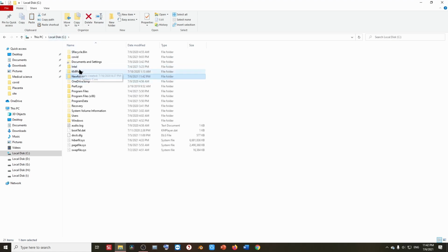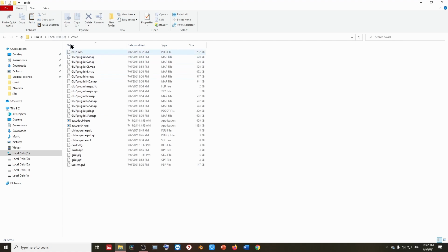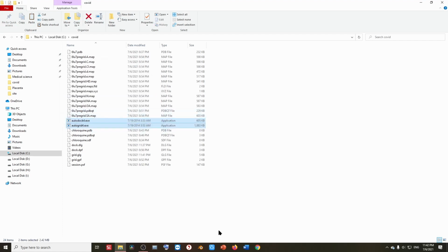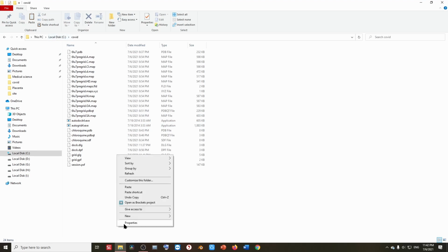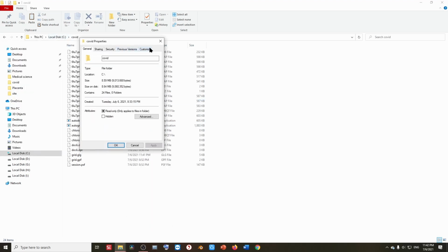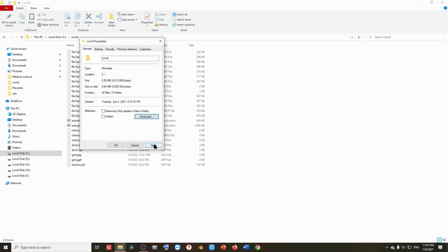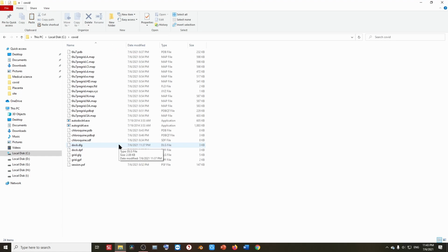I have already copied it in this folder. Here is the COVID folder, and I have already copied it. Let's repaste it. Now the next step is to go into the properties of this folder, and here let's uncheck read only and apply. Let's apply it.